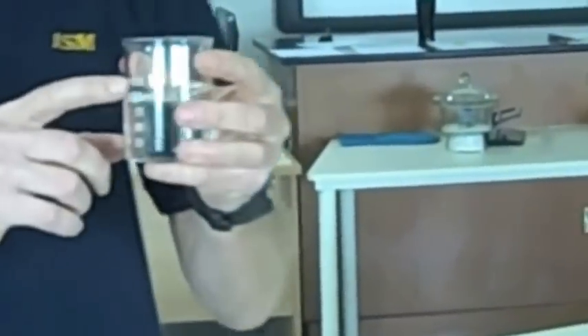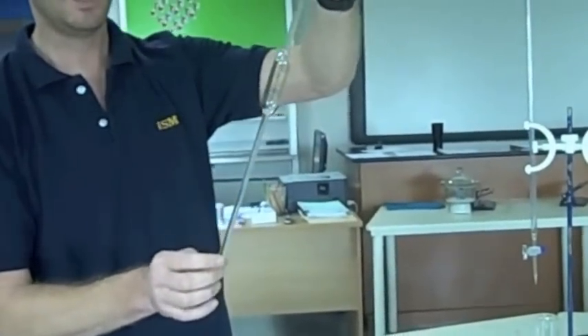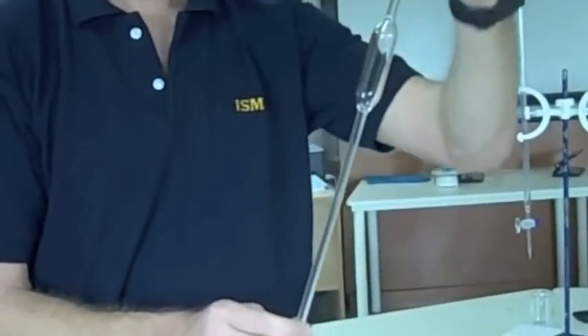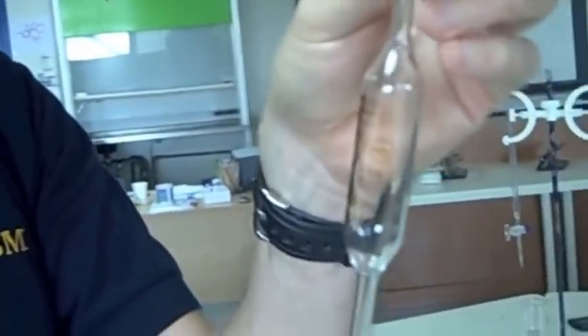This, by the way, should be completely clean and dry — it cannot be wet, because otherwise we have changed the concentration of the sodium hydroxide. My pipette — this is a 25 ml pipette. If we measure up to our graduation mark here with the meniscus on it, it will have a precisely known volume of 25.00 cc's — four significant figures.